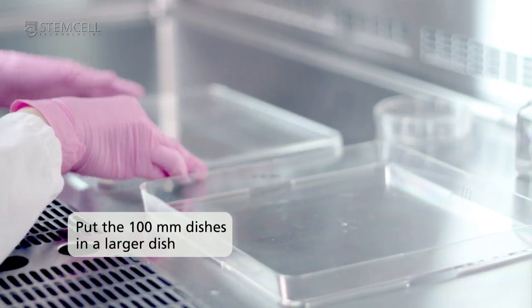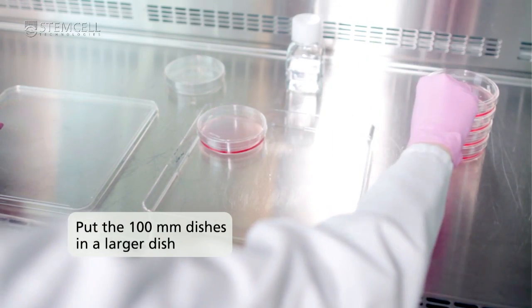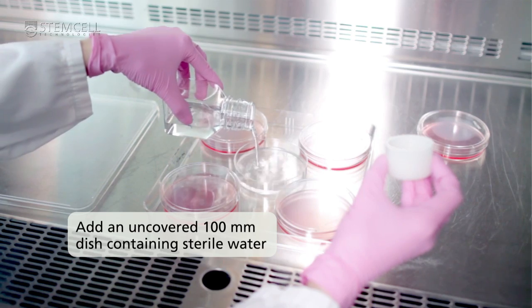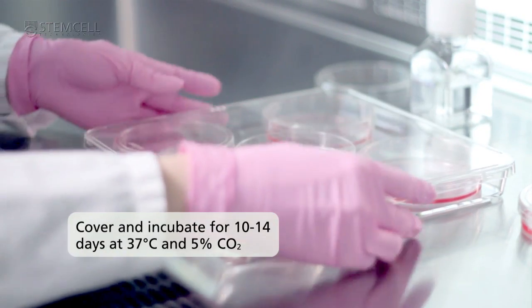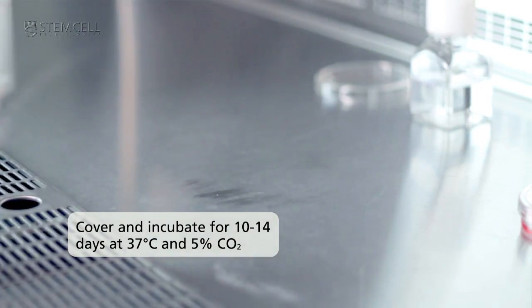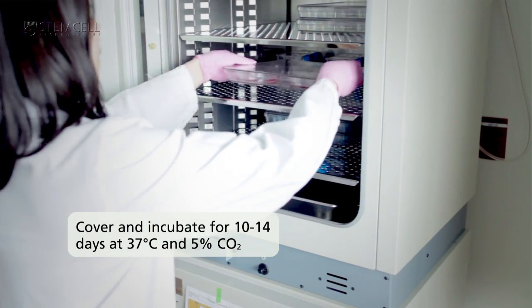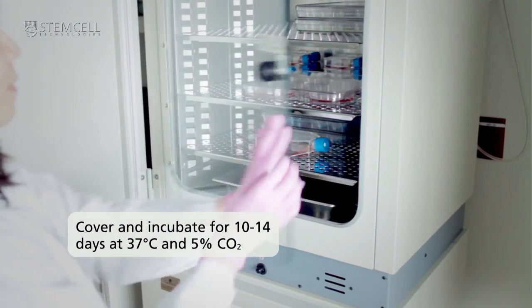Put the 100 millimetre dishes inside a larger dish and add another dish containing sterile water with no lid to prevent dehydration of the cultures, then cover the dish. Incubate the plates for 10 to 14 days at 37 degrees Celsius and 5% CO2.